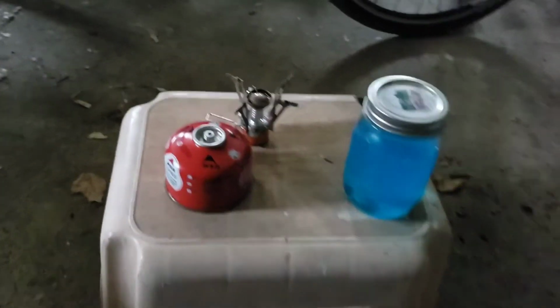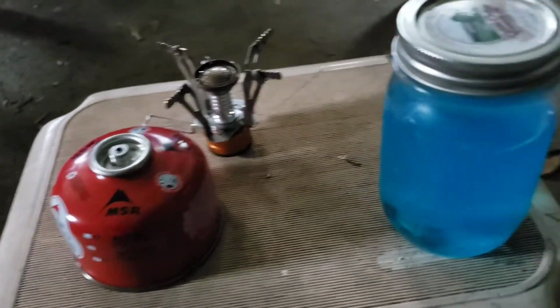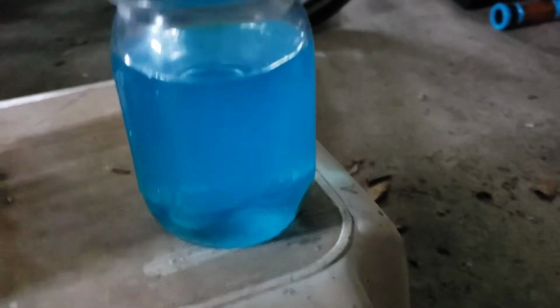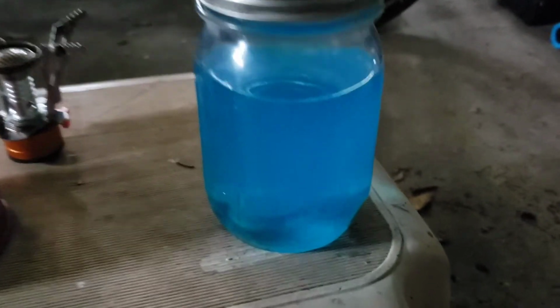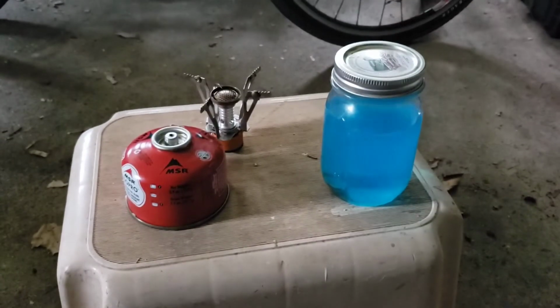But once I had the solution, I was very impatient, and I really didn't want to just wait for it to evaporate, so I decided to just grab my little trusty camp stove and boil it off. And as you can see, here's the setup I had, just on a little stool in the garage. And for some reason, I didn't even bother to remove the pennies first, even though the copper acetate would precipitate out right onto the pennies, which was kind of dumb.